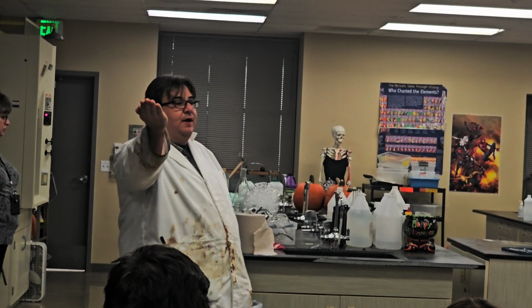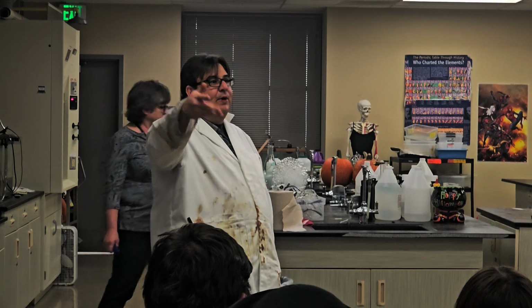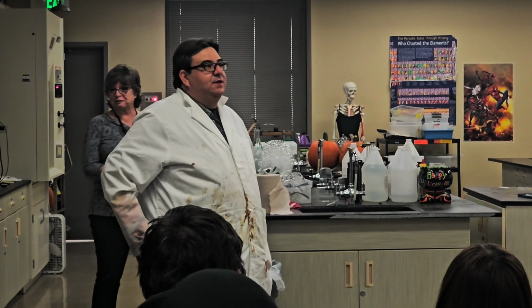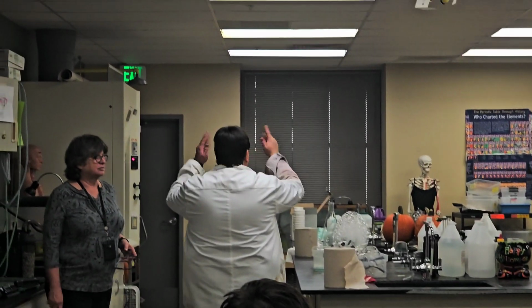And then the other reason why Miss Basil holds is so that you don't come down, also that people want to wiggle. Don't wiggle. Okay? You wiggle, now you're throwing fire at Miss Basil, lighting her on fire. She's definitely not going to appreciate that. So don't wiggle. Okay? So she will hold your arm nice and tight. So you'll come over here underneath this vent, facing this direction.